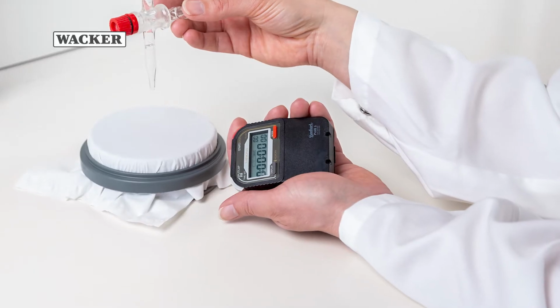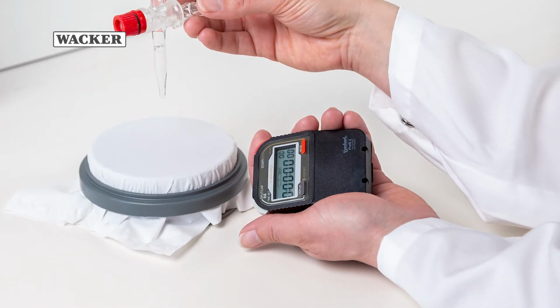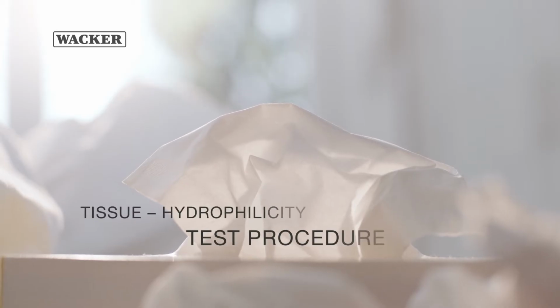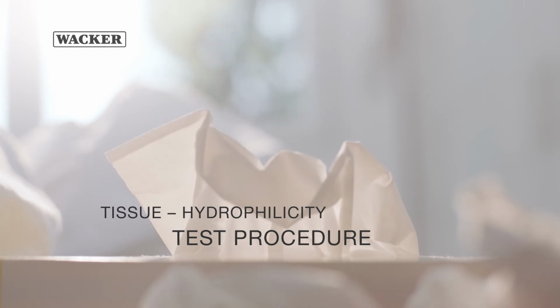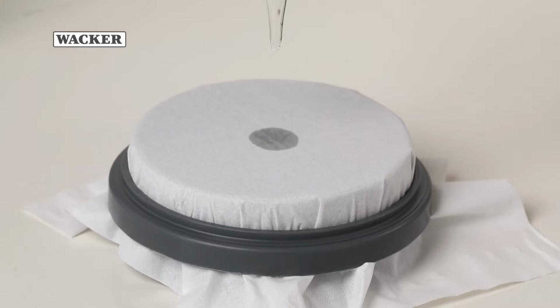For each type of tissue, stretch a sample, coated side up, into a ring, so that the tissue does not make contact with any surface. Mount a burette 5 cm above the tissue. Release a drop of deionized water from the burette onto the tissue. Use a stopwatch to measure the time required for the tissue to absorb the droplet.